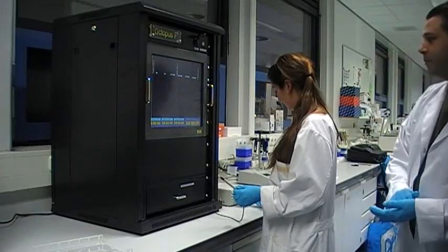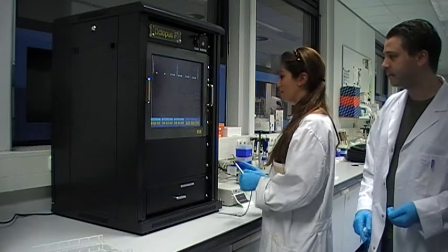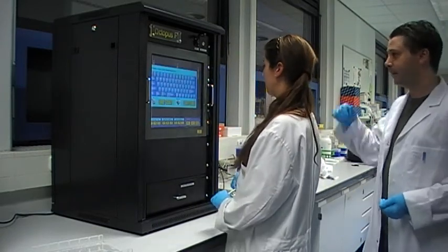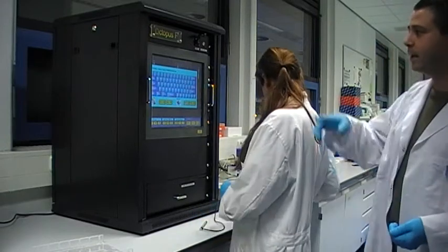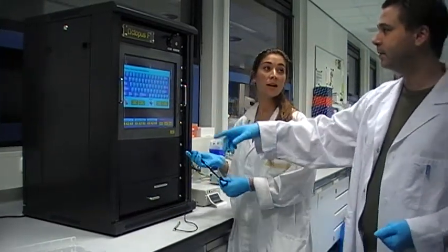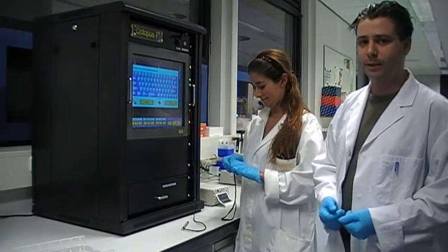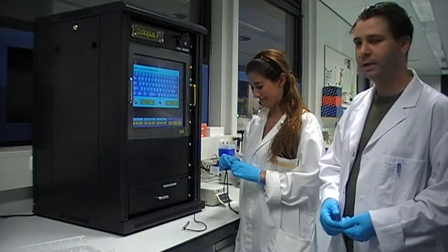You can also save the image by tapping the save button. The save button starts up a dialog with a touch keyboard, so you can select your file name. And you can choose to save it either on a USB stick or a network.